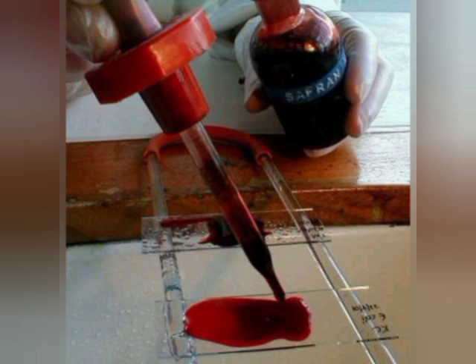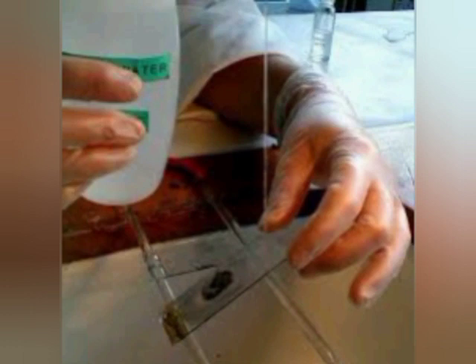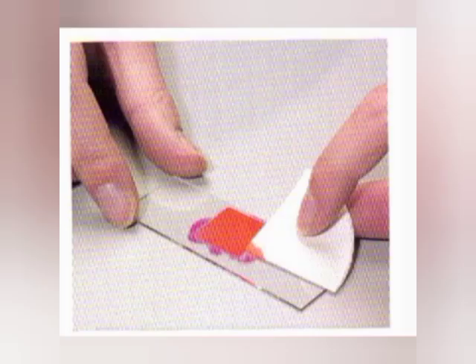Keep it aside for two minutes. After that, remove the extra stain by using distilled water.